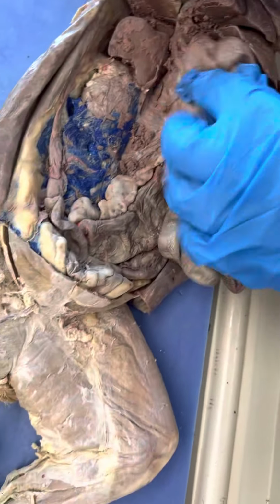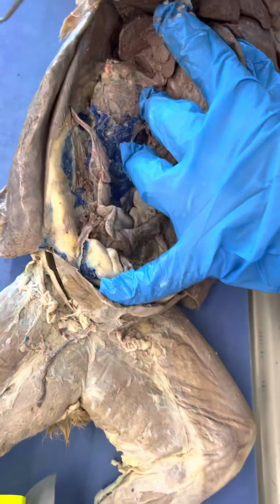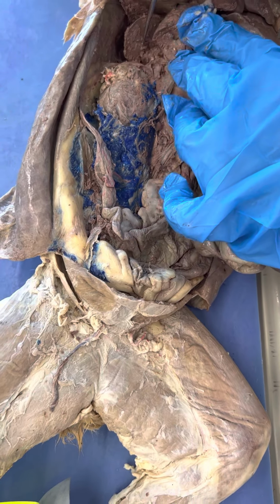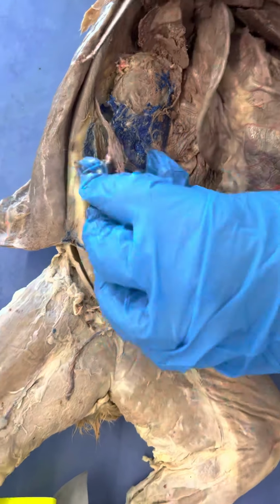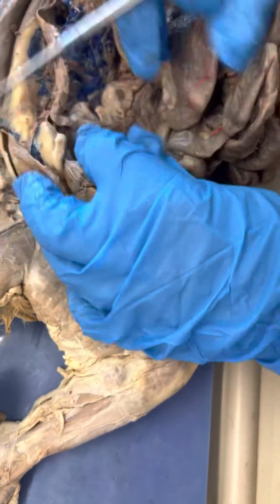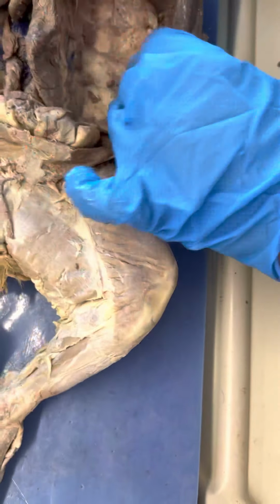Okay, back in here they did not really clean them out, but you can clean out the kidneys. Kidneys are retroperitoneal, so you can pull off the peritoneum. The adrenal glands are on top of the kidneys. They would be on top of the kidney. You should be able to find the bladder. And I don't know if I can find it on this cat, but there should be ureters going down to the bladder. They are something you can find on the cat. But you would have to clean it out a little bit.